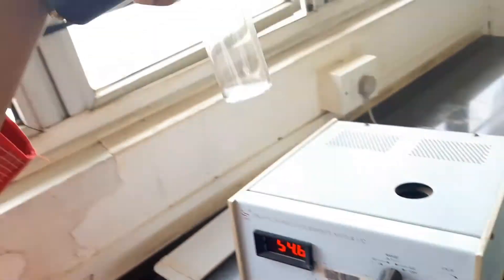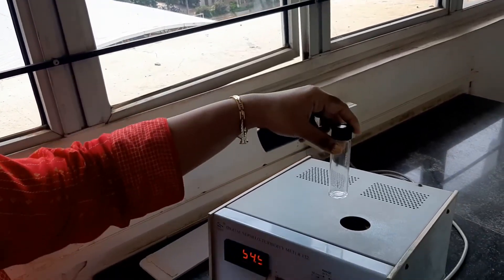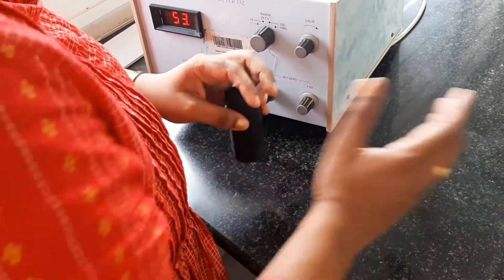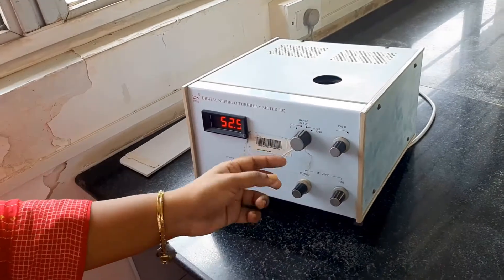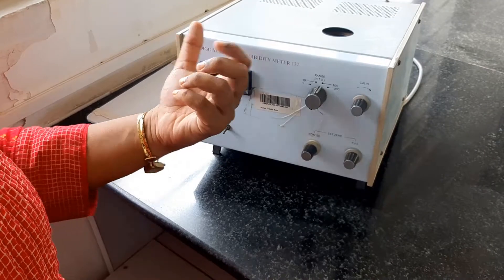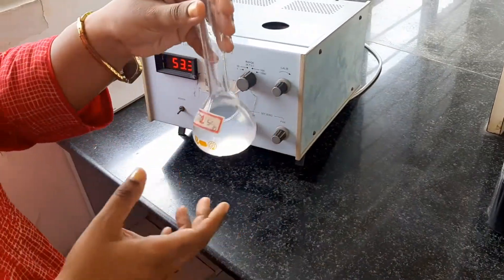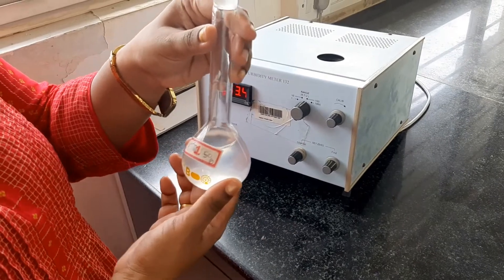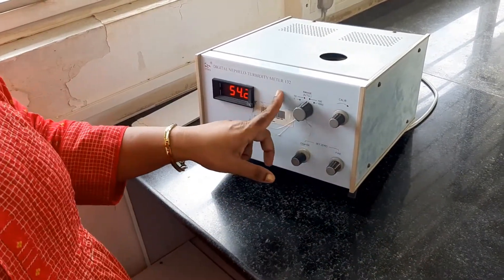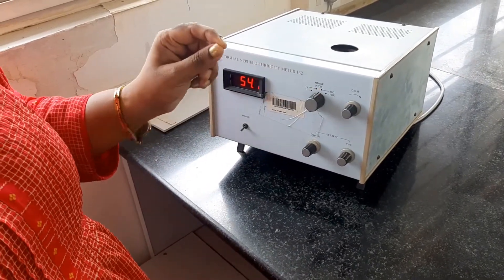You have a tube like this. We will be keeping the sample here, closing it, and then we will be seeing the value. Now before we start the experiment, this is a range. We always keep it in the 100 range. That means it can maximum measure the value of 100.